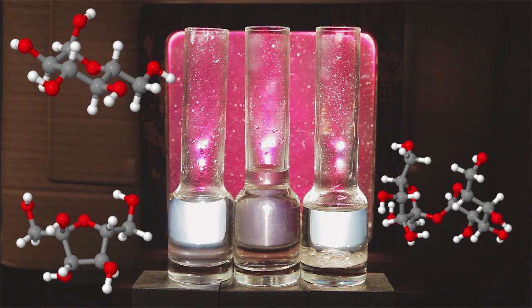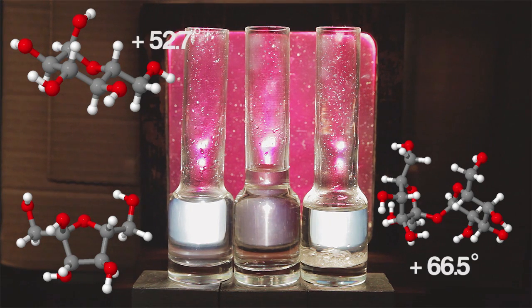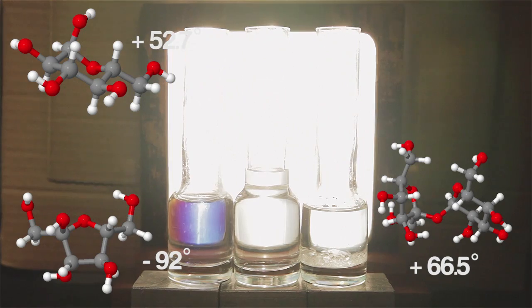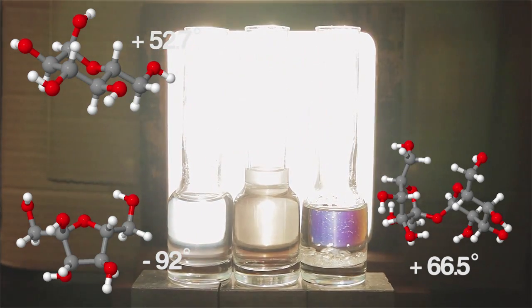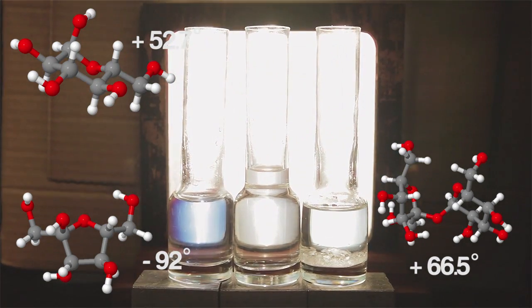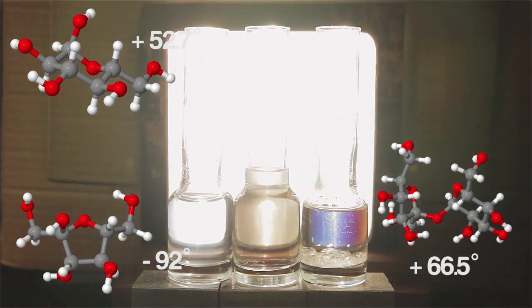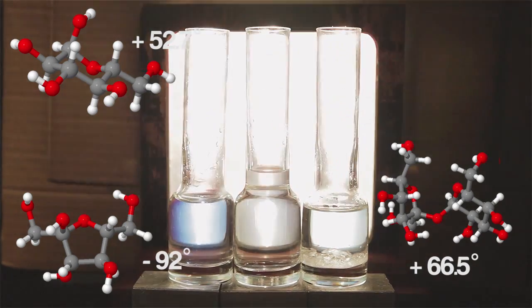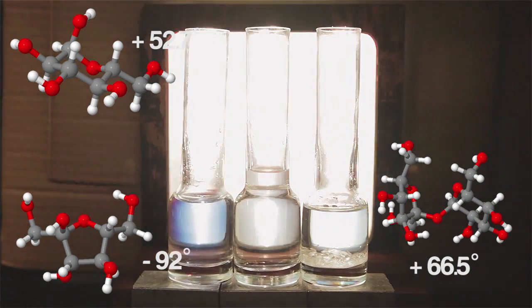We now have a mixture of sucrose rotating right, glucose rotating right, and fructose which rotates strongly left. Watch as I rotate. The solution in the center now rotates somewhere between the other two. Left hydrolyzing long enough, the solution will begin to rotate left, hence being known as invert sugar syrup.